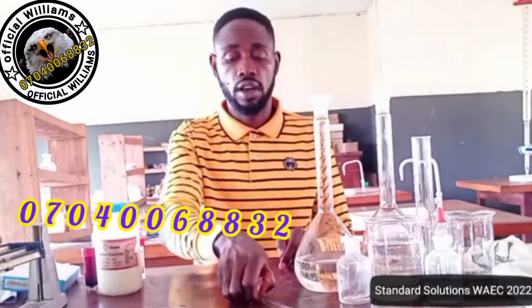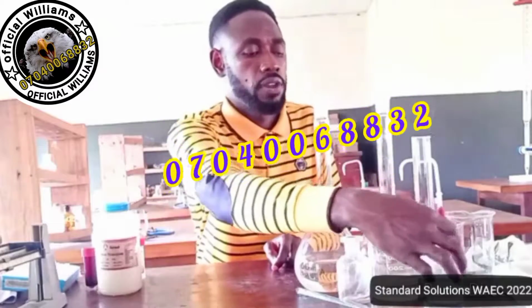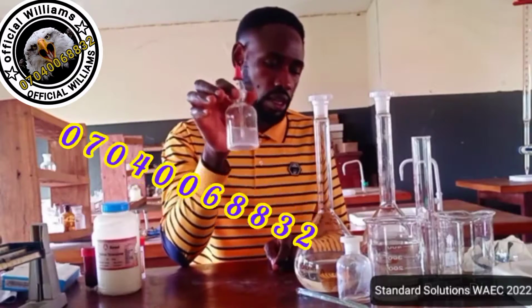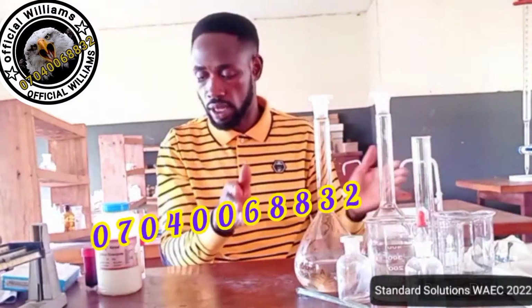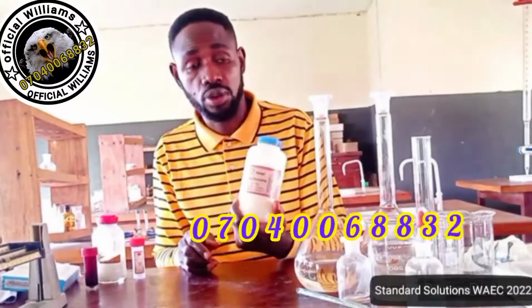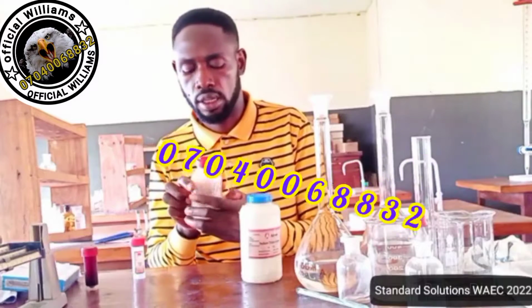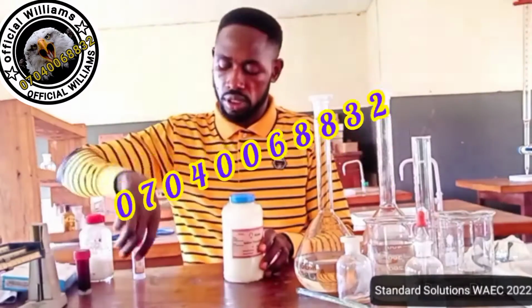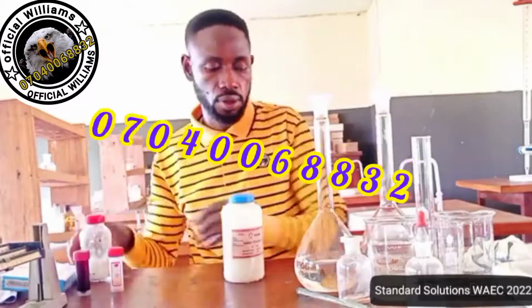Then there is the need to have the glass rod. The glass rod is here. Then definitely, they also require this starch solution. Of course, this one is here already settled. Then I have this beaker to help me in volume measurements and assessments. Then the solid sample of the sodium thiosulfate, the pentahydrate of it. Then I have my potassium iodide here. Then I have my iodine. So this is the measured potassium iodide, this is measured iodine, to save time in this video.